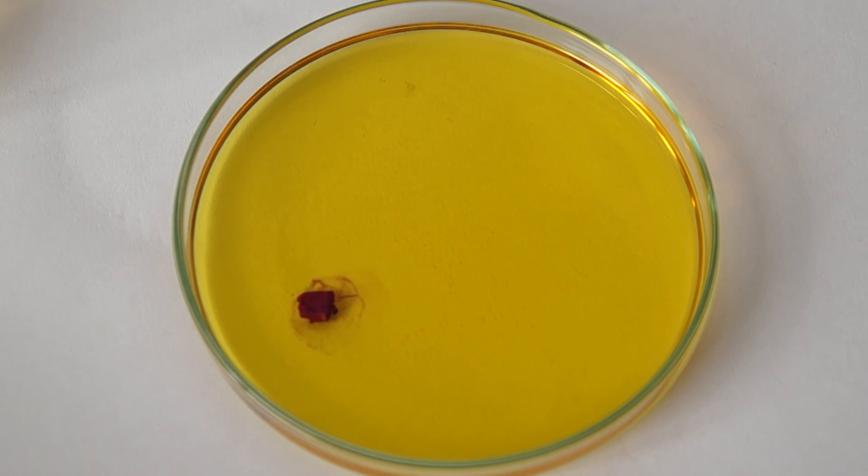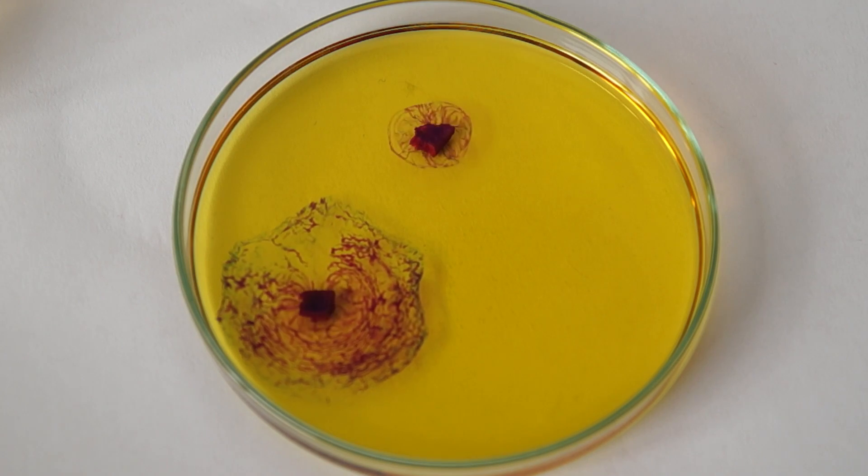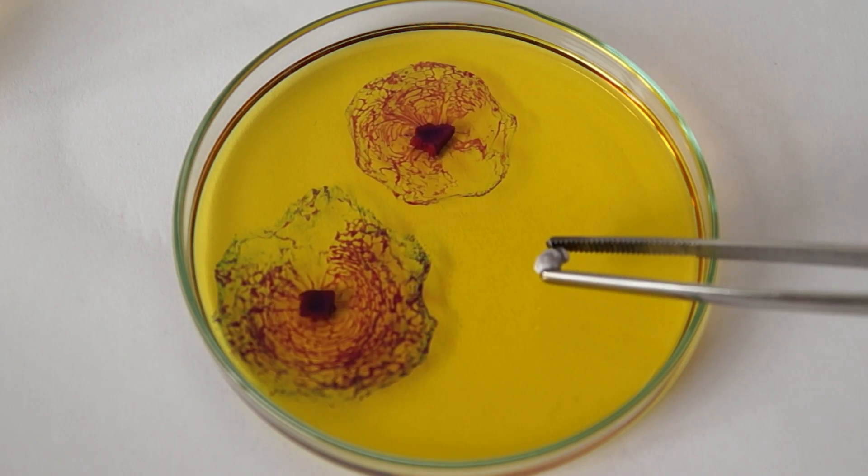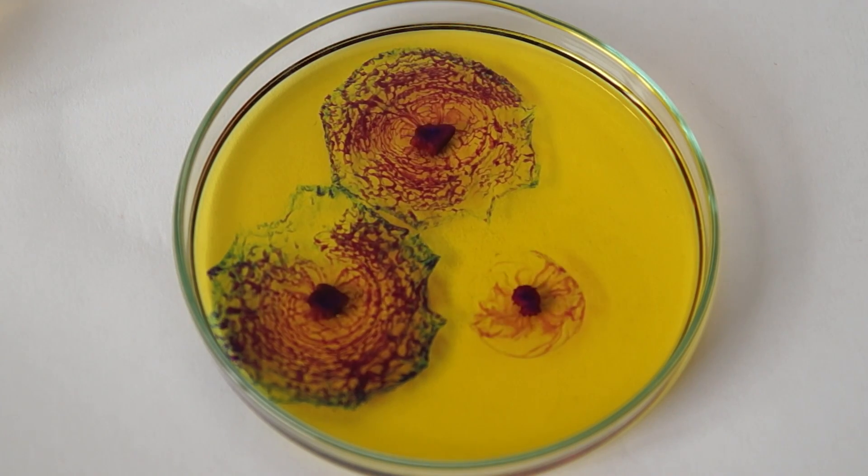And now let's proceed with the reaction itself. Take the small pieces of sodium and throw them into the petri dish with our indicator solution. After this we can observe a very nice effect.